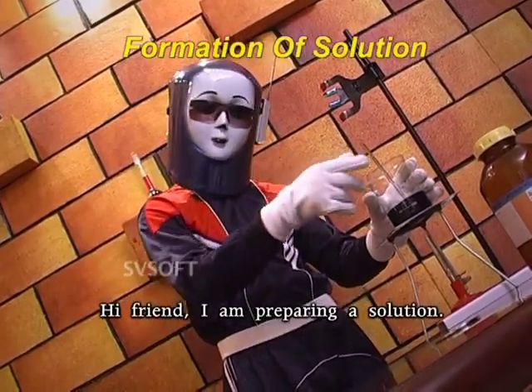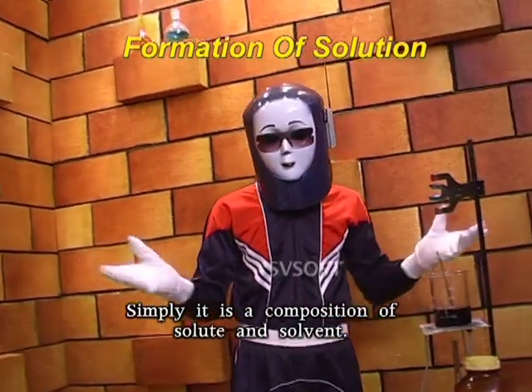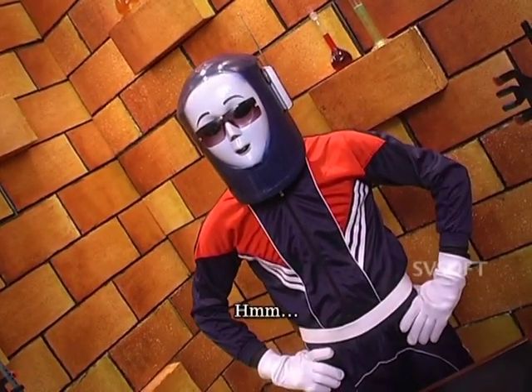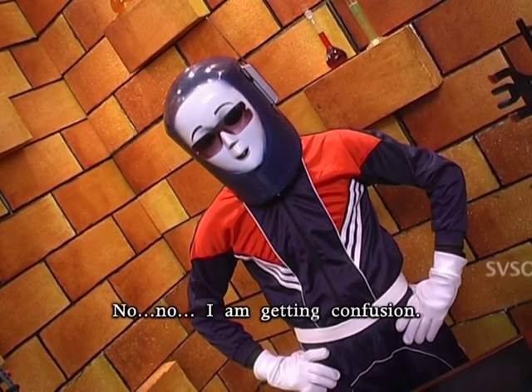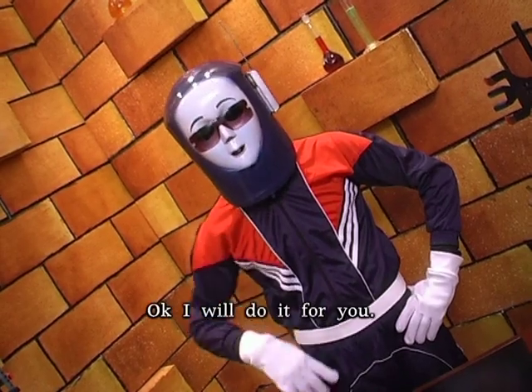I'm preparing a solution. Solution? What does it mean? Simply, it is a composition of solute and solvent. Solute and solvent? No. I'm getting confused. Could you explain clearly? Okay, I'll do it for you.